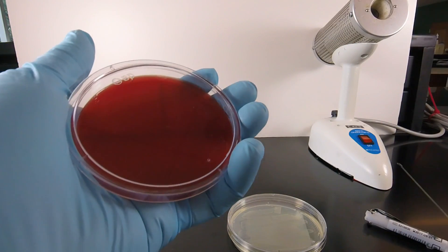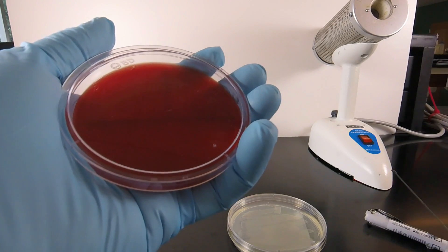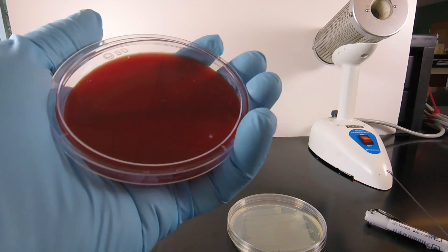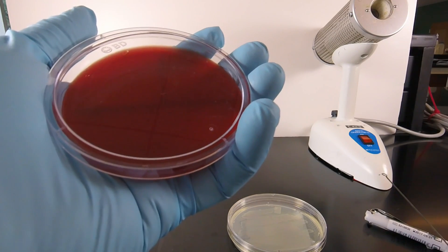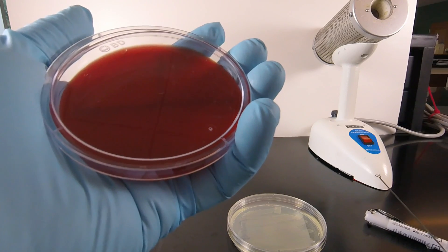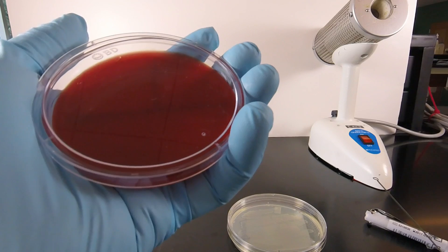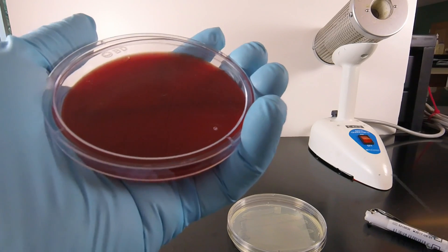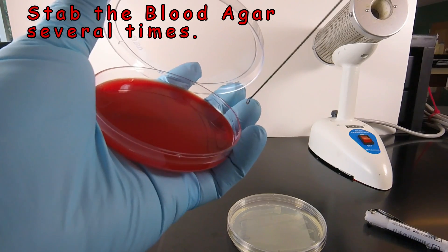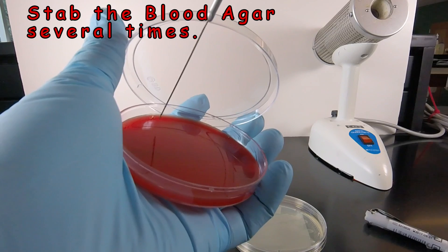Since this is blood agar, once we've streaked the plate for isolation, we stab the agar a couple of times in each of the three growth areas so that some bacteria grow under the agar. That allows us to see more hemolysis faster, especially since certain hemolysins are inactivated by oxygen. So once we've spread the bacteria in Sector 3, we go straight to the agar and do a couple of stabs in each of the three growth areas.